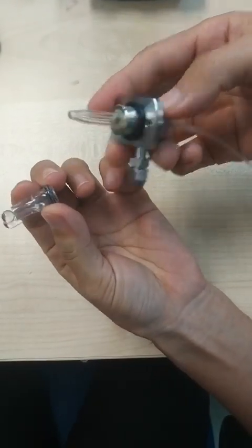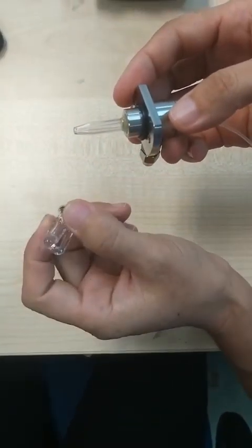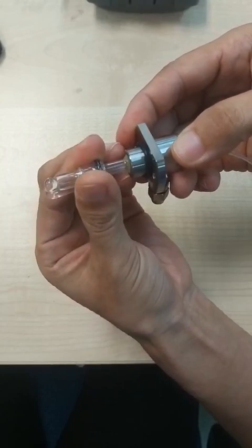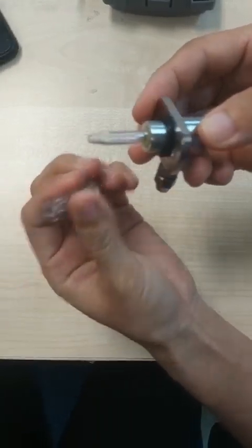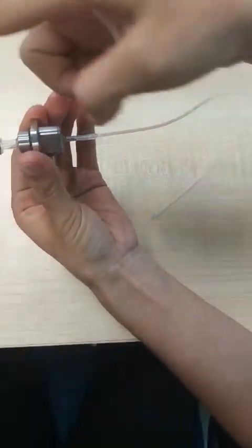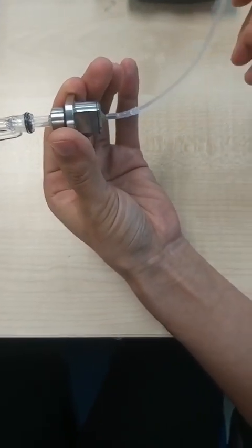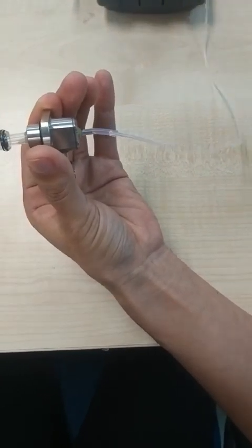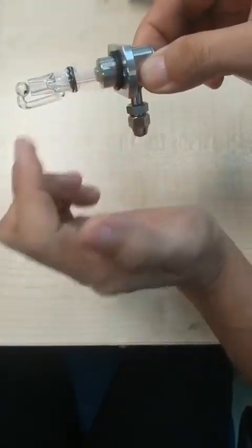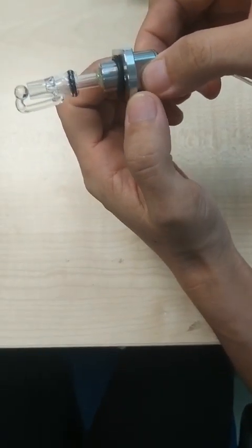After finishing use, you must wash it once you finish your application. Otherwise your chemical will deposit out on the surface. During washing, you can take this one out and flush it with water, or you can do it in place. Use your washing solution passed through by the gas carrying, then rinse with a solvent wherever your compounds can be dissolved. This ensures all compounds inside are carefully carried out with no residue. This is made of glass, so hydrofluoric acid cannot be applied.